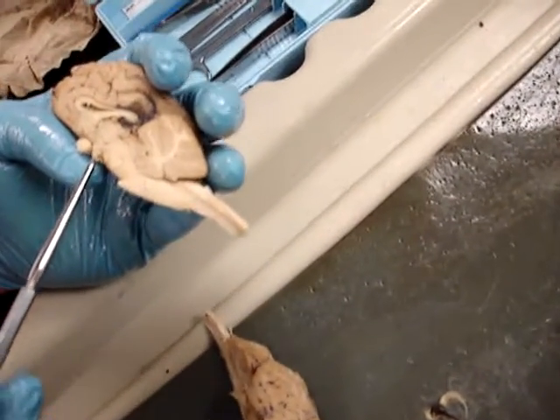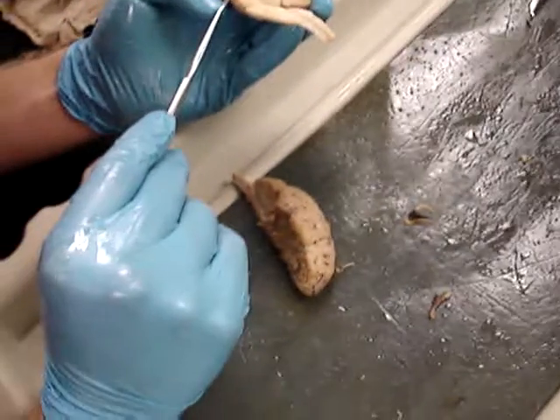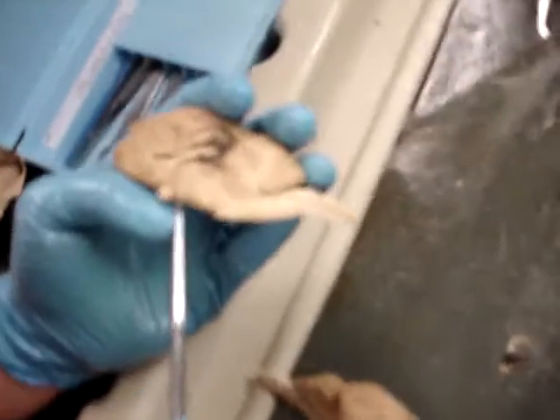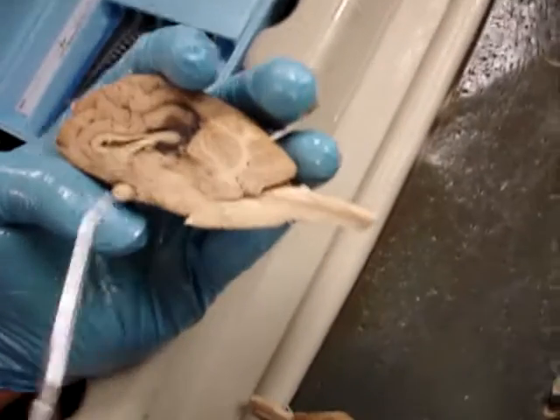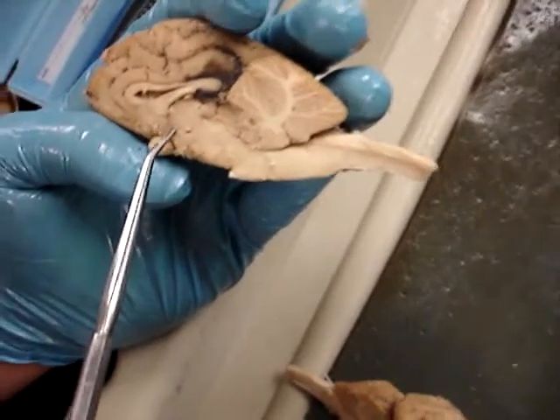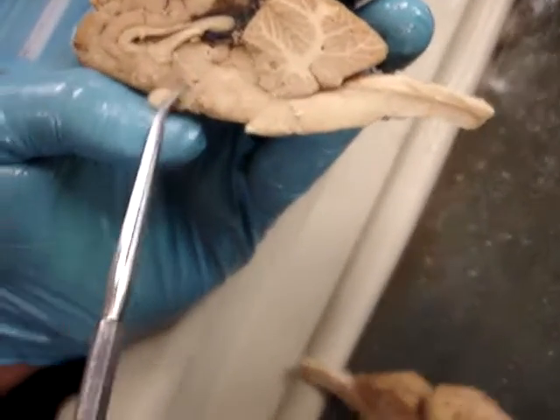It's still called the interventricular septum. And then the hypothalamus is this darker area right here.